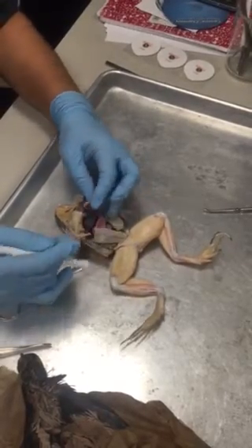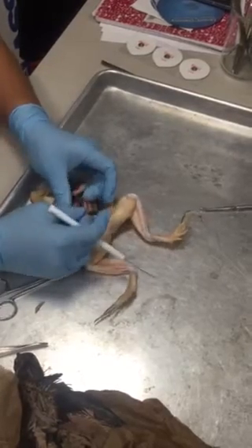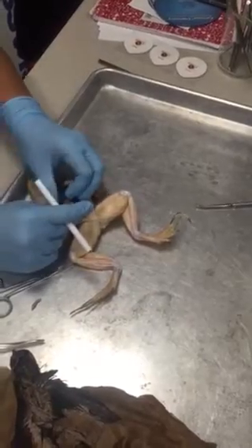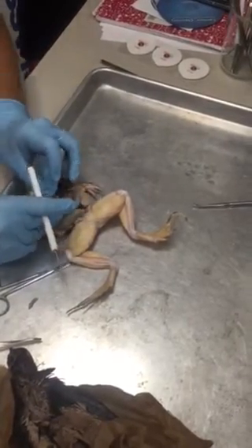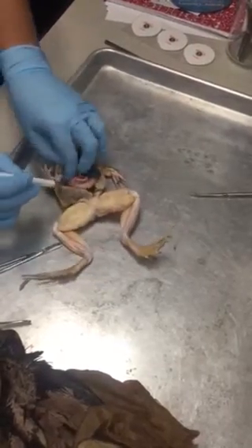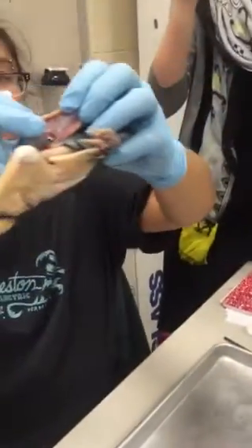Okay. Now if we move further posterior, we remember here that we have the jejunal-ileum, and the jejunal-ileum is joined together by this big mesentery, the mesentery proper. And if we look in the mesentery proper, you'll see that there are tons of arteries and veins. Okay? The pink are the intestinal arteries, and the blue are the intestinal veins.